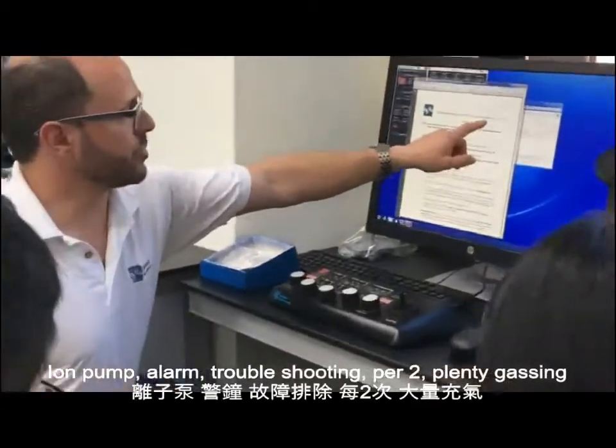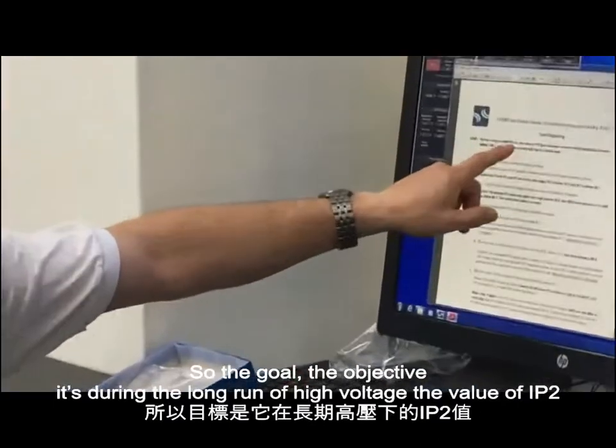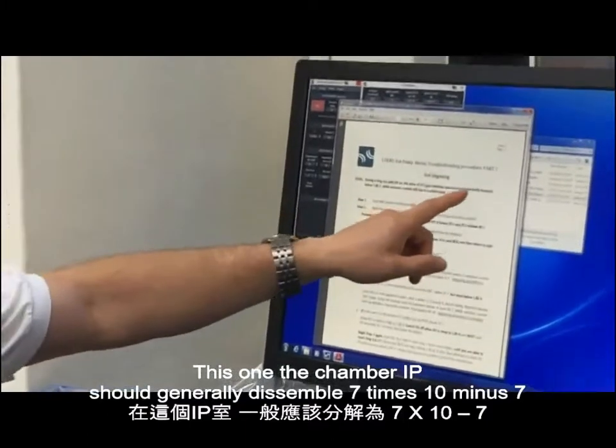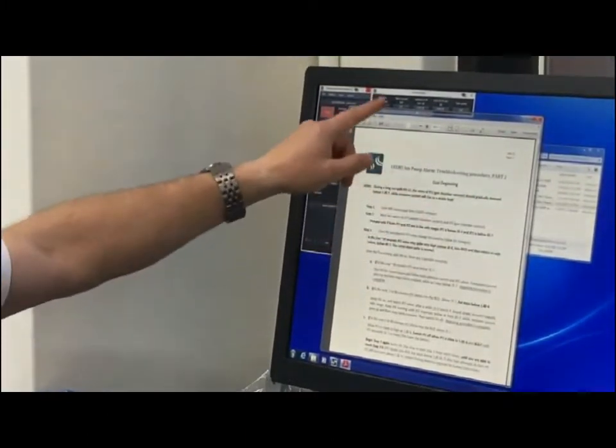Ion pump alarm troubleshooting part 2, gun degassing. So the objective is during a long run with high voltage, the value of IP2, so this one, gun chamber IP, should generally descend below 7 times 10 minus 7, while the emission current will rise to a stable level, so emission current.